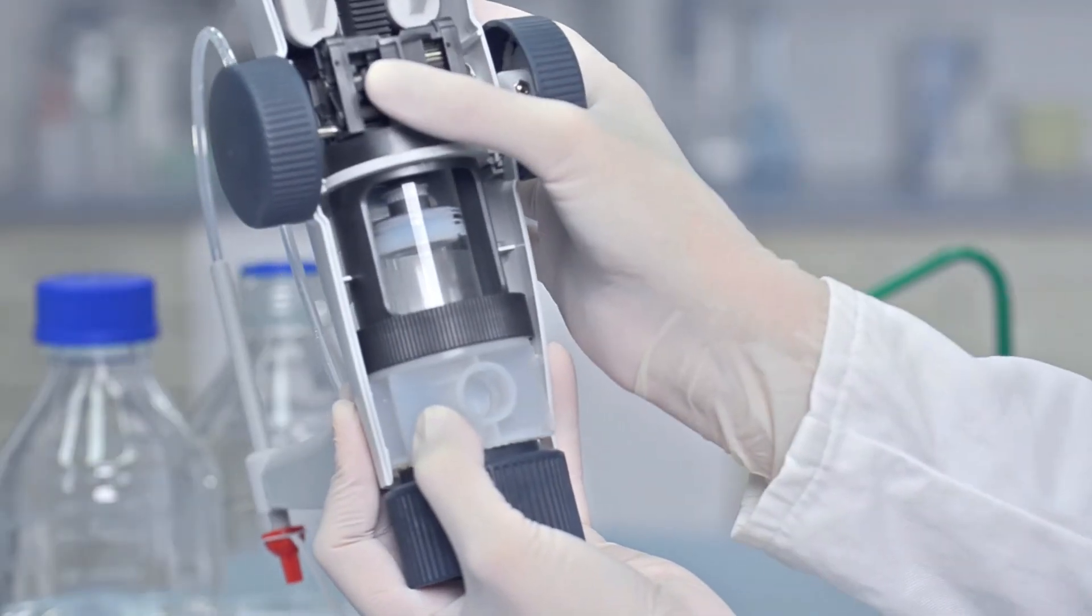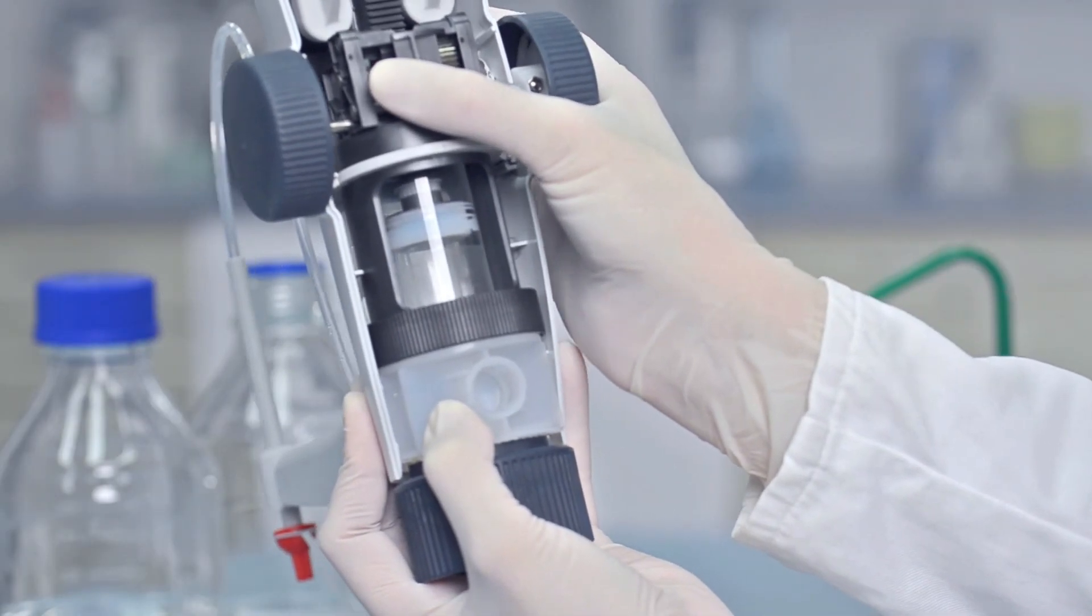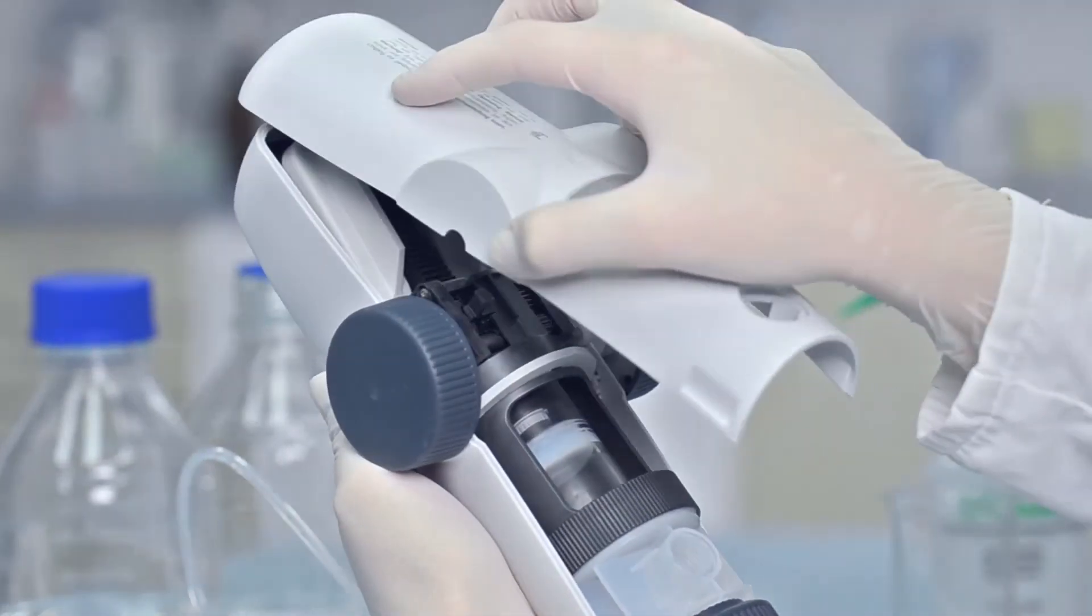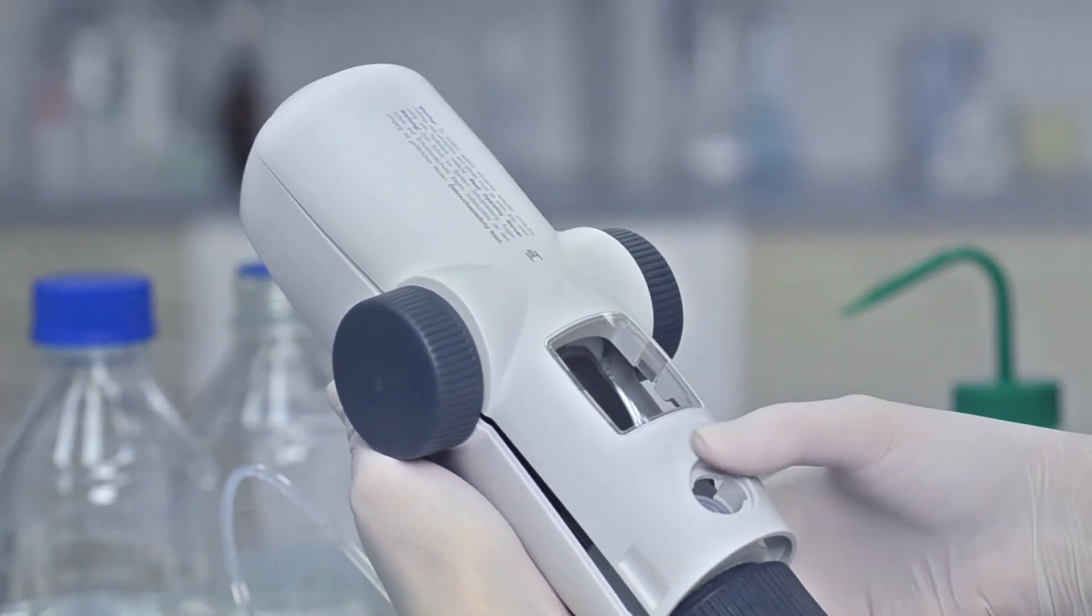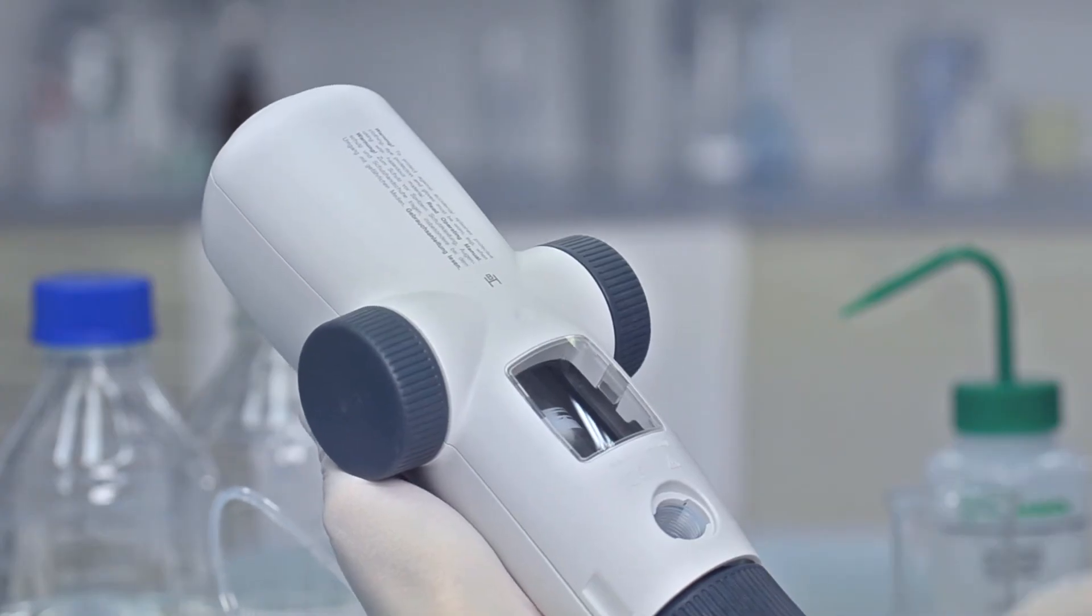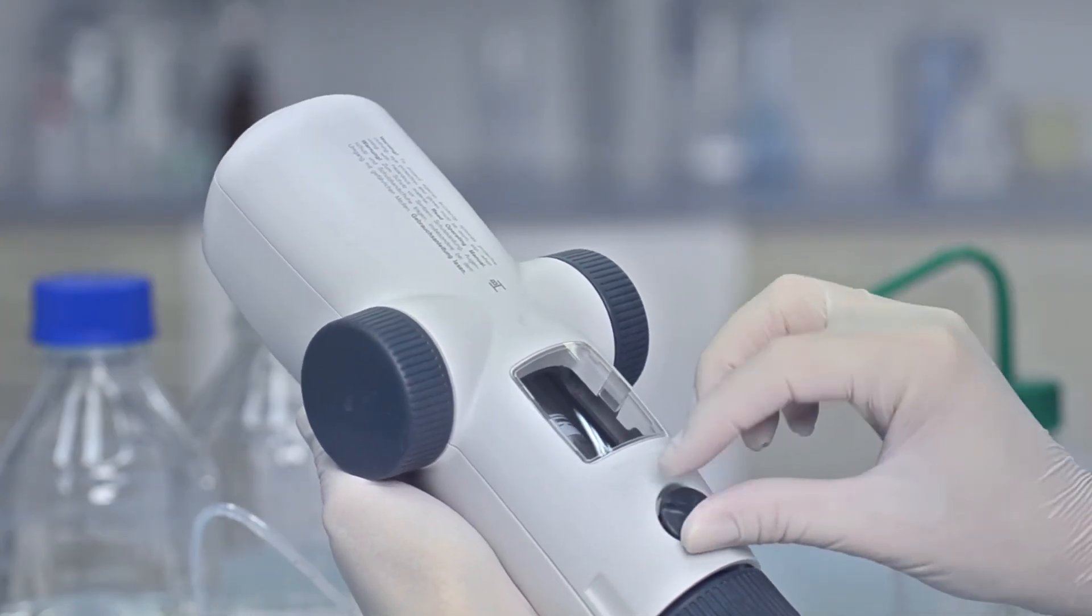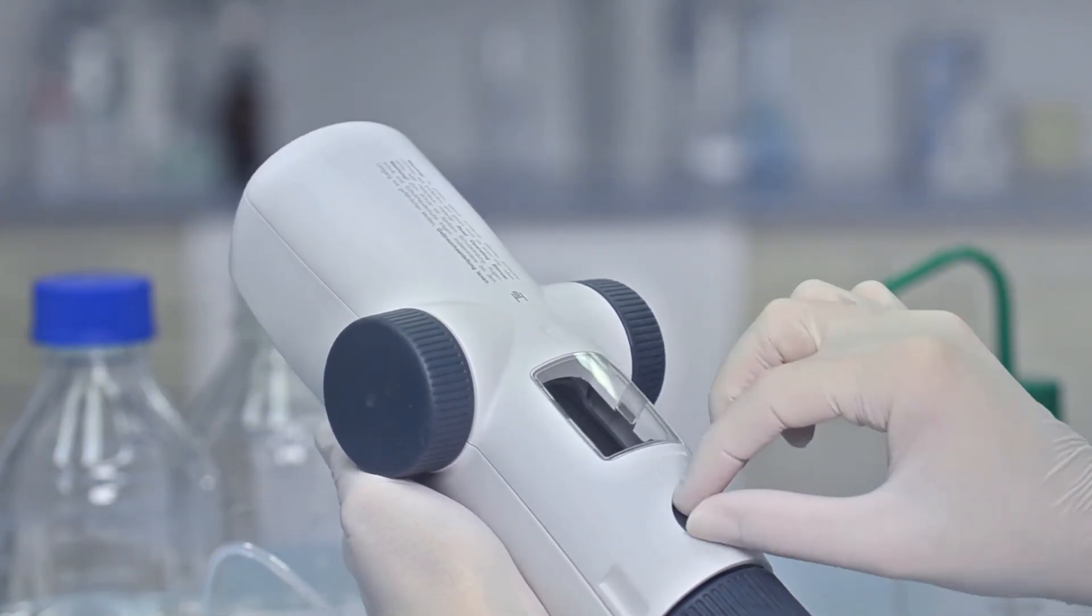Press the piston rod locking mechanism in up to the stop. Then connect the rear housing at the top, snap it closed, and screw in the air vent cap.